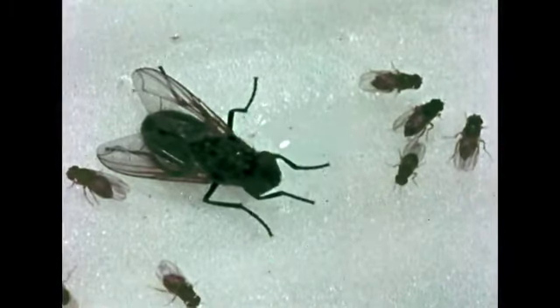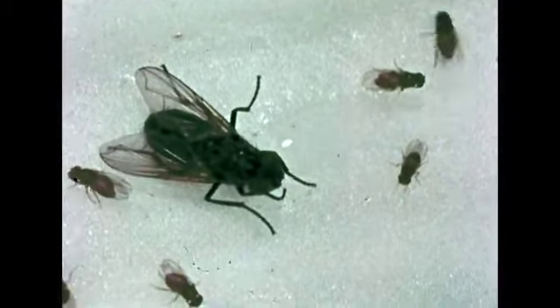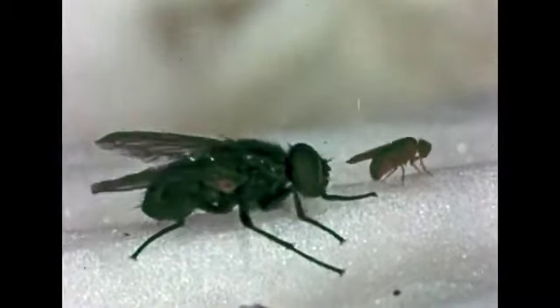A common insect sometimes found around a house is the fruit fly, Drosophila. Fruit flies are very small compared to an ordinary housefly. Adult fruit flies are only about 3 millimeters long. In a laboratory, we can anesthetize some fruit flies and examine them closely.